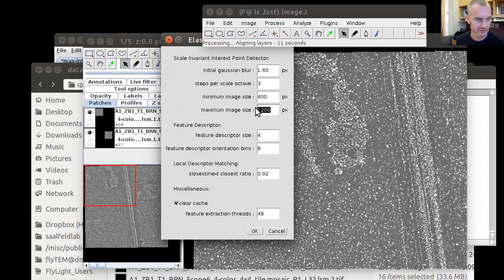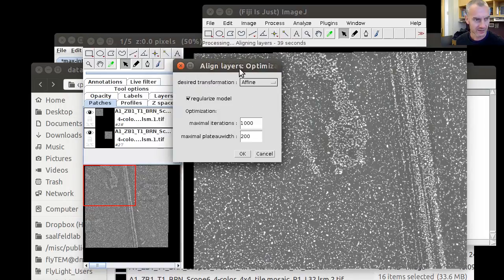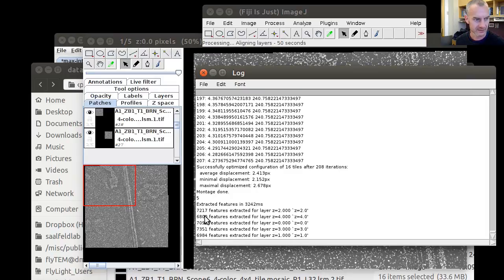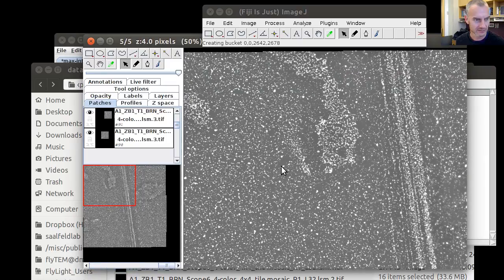We use 400 to 1200 pixels as the scale space range, and feature descriptor size is again 4 because we're expecting to see approximately the same structure in here. We compare all to all layers, so 5, and we allow a maximal transfer of 200 pixels, which probably is not happening, and we're expecting a translation. And we're seeking for the translation that explains that best. So we're seeing in the range of 6 to 7 to 8,000 features extracted. These feature sets are getting compared and optimized runs.